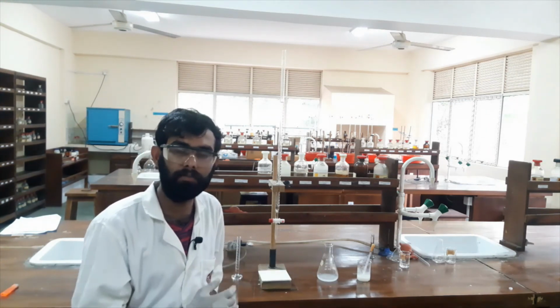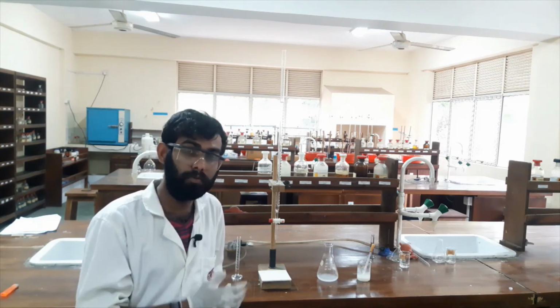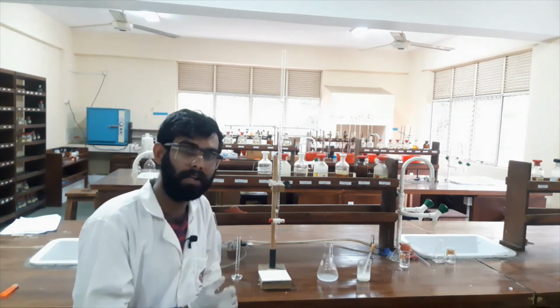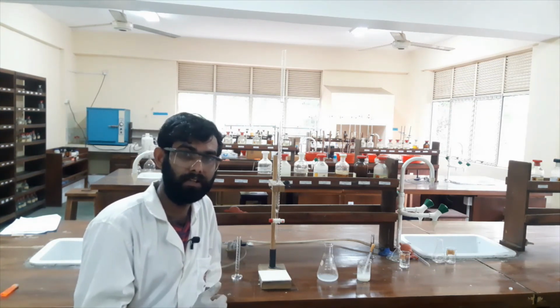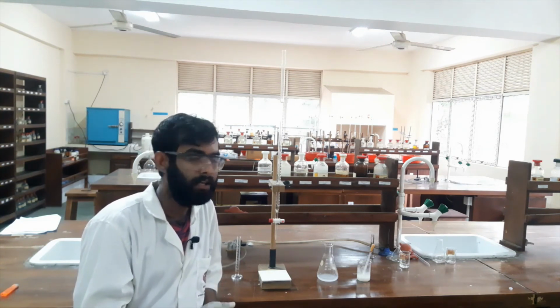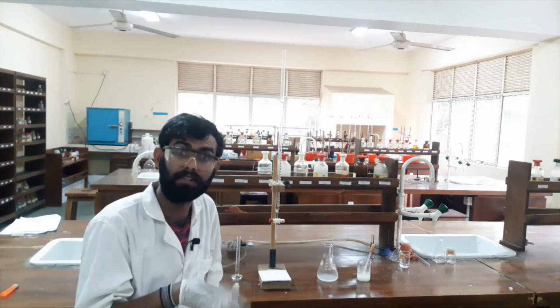So, there are so many important steps we saw. I taught you very clearly. It is a very interesting phenomenon in chemistry, an experiment in chemistry. So, please keep these things in your mind. Okay. Let's study another experiment in another video.